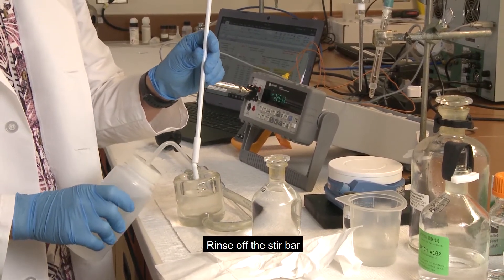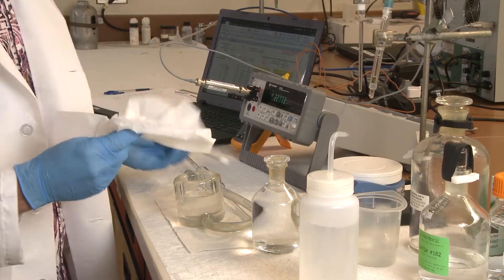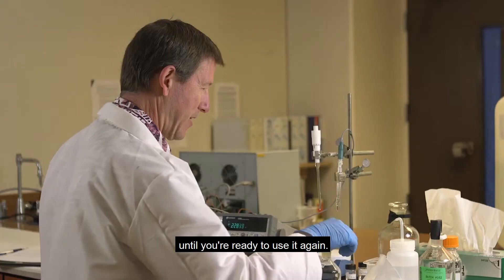Rinse off the stir bar with your distilled water and just set it aside until you're ready to use it again.